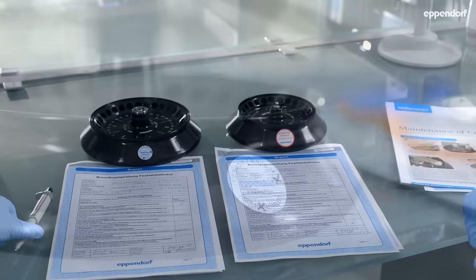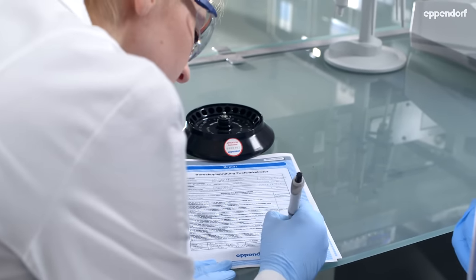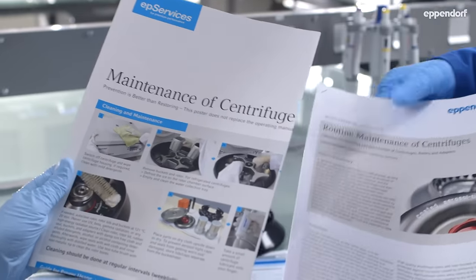Further information can be found in the Maintenance of Centrifuges poster, in White Paper No. 14, Routine Maintenance of Centrifuges, and in the Operating Manuals for Eppendorf Centrifuges.